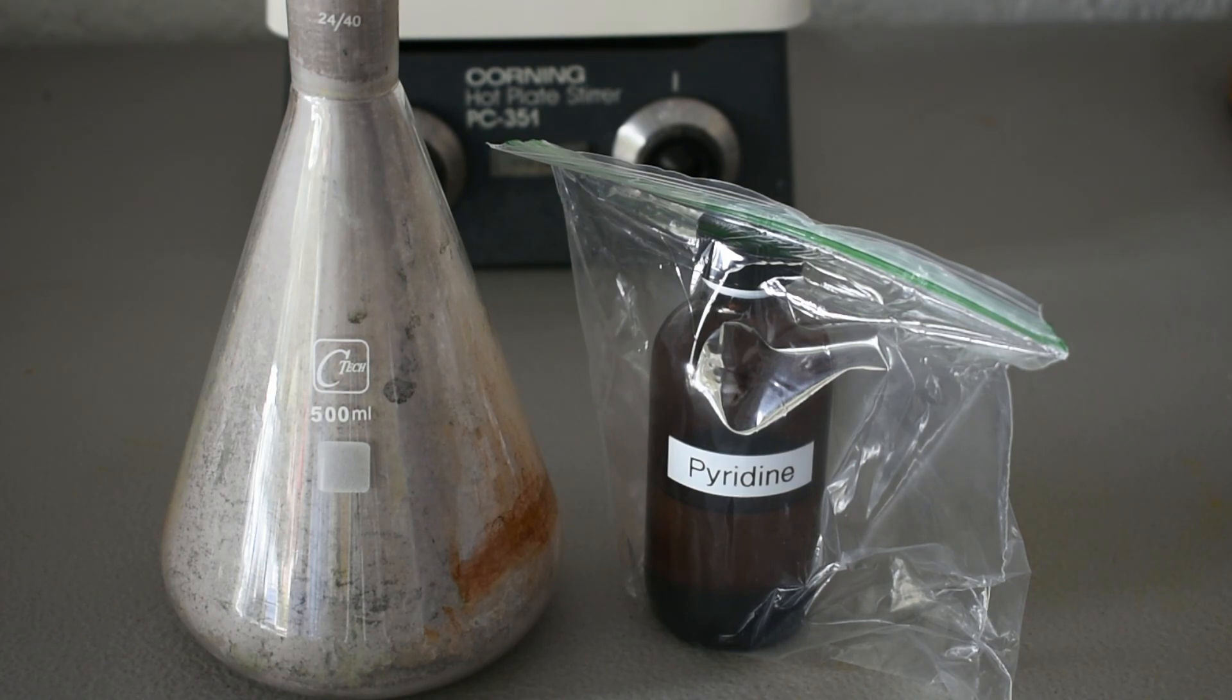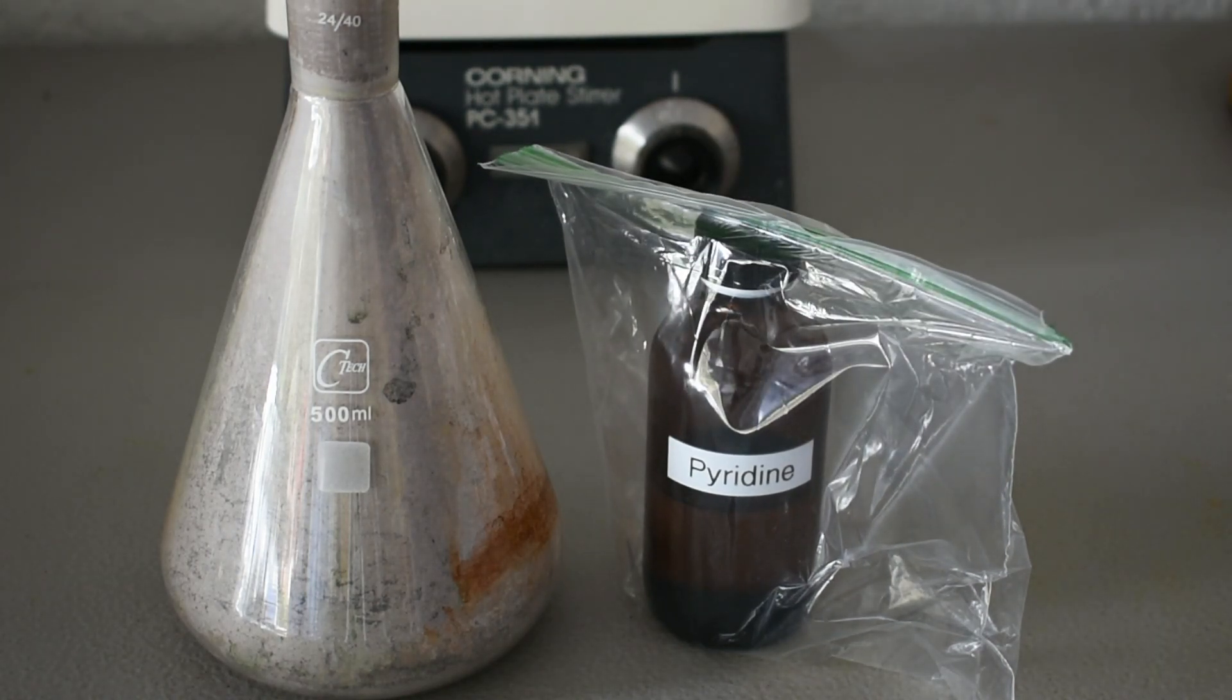I did some preliminary test tube tests and the yellow color that is described by some papers that I found is very evident. And hopefully when I do this on a larger scale, it will be very nice and I'll get some nice crystals out of it.